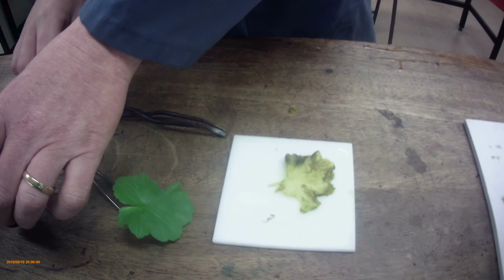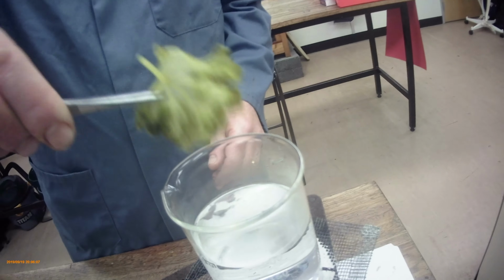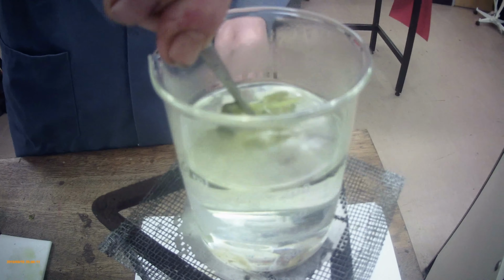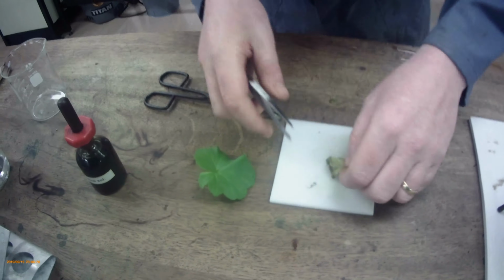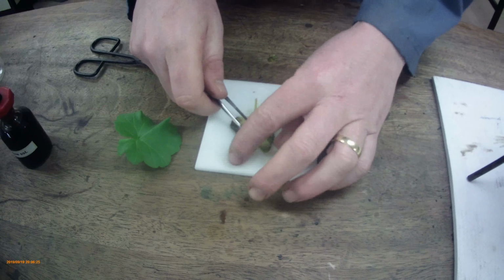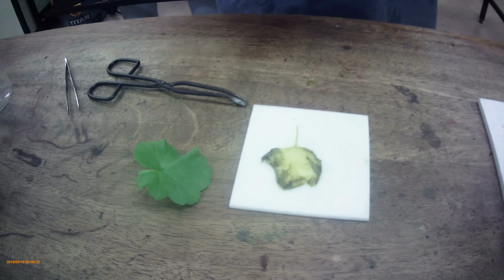However, before we do that, we're just going to make sure there are no other parts of ethanol on top of the leaf, and we're just going to dunk it back in the water just to clean it, just to make sure there's no other ethanol on it. Nice and carefully give it a wash. Any excess chlorophyll also comes off, so that water turns green a little bit. And now let's have a look. Let's break open that leaf again. Okay, so little bits of green still left, but here the chlorophyll has definitely come out.